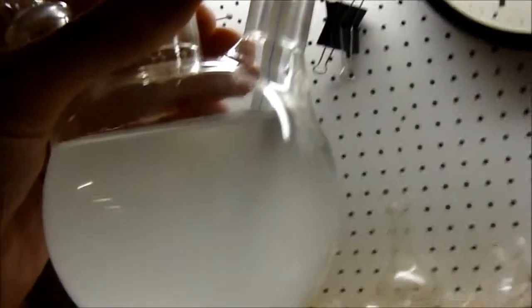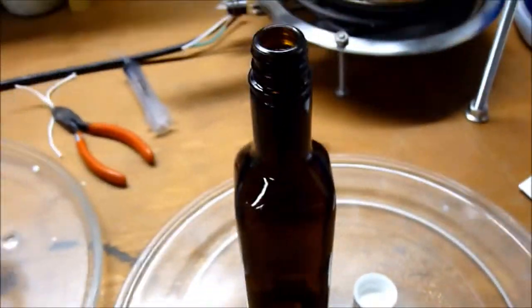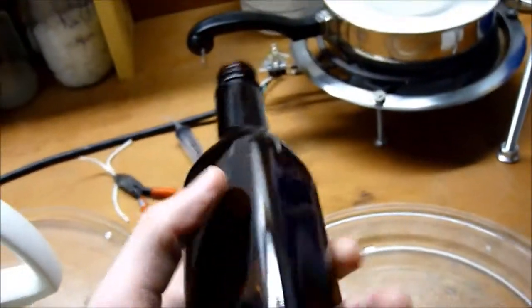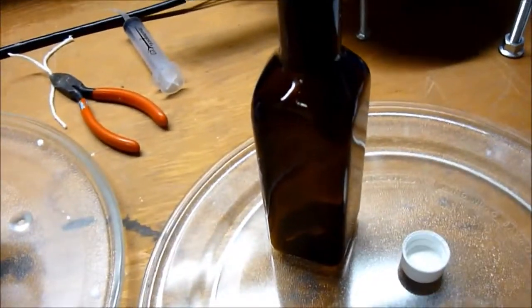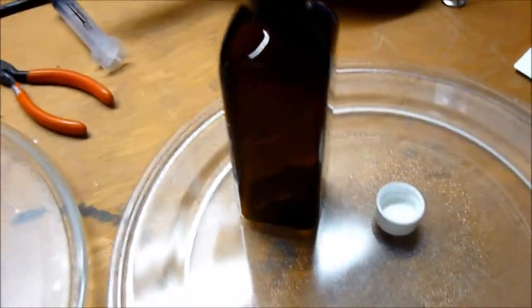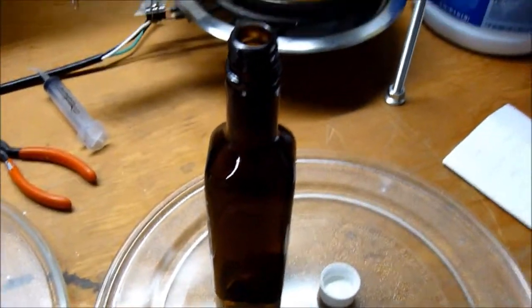Once most of the cloudiness settles and agglomerates at the bottom, I'll then pour off most of the reaction mix and use my separatory funnel here to separate the liquid phase at the bottom. I'll store it in this nice amber bottle because chloroform is photosensitive and will degrade in the presence of light, so it's always stored in dark glass bottles.